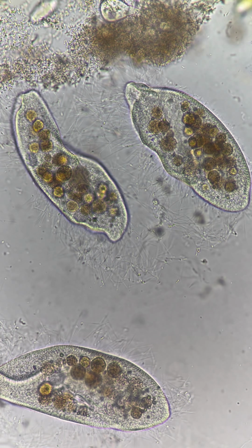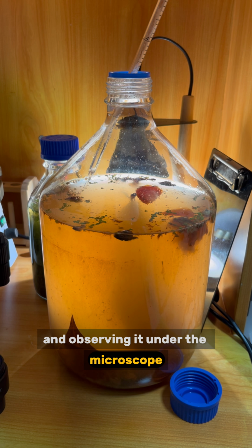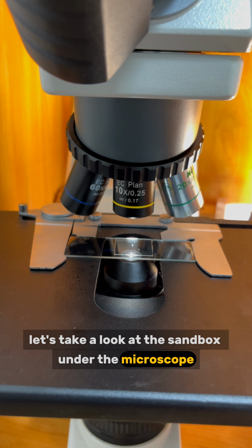See you tomorrow. Day 82 of creating a microbial sandbox by adding random stuff and observing it under the microscope every day. Later, we'll conduct a stress test on the microorganisms. But first, let's take a look at the sandbox under the microscope.